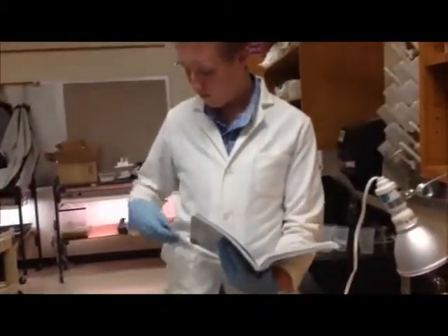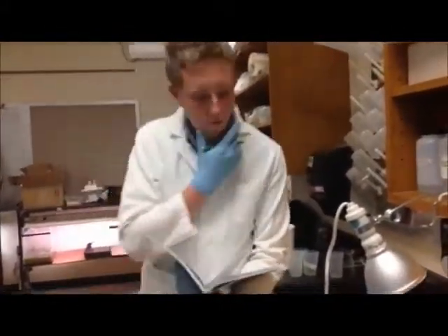After the 3 minutes we begin collecting data and we collect data at 0, 5, 10, 15, and 20 minutes.